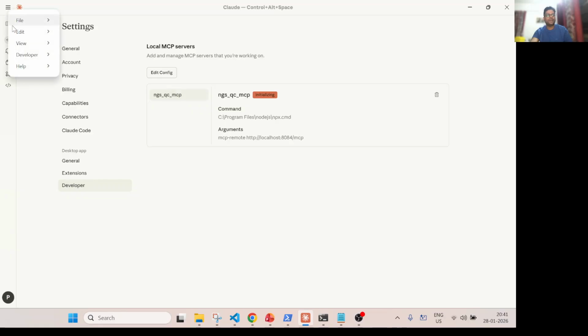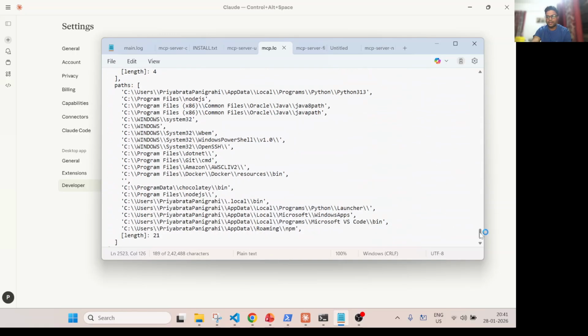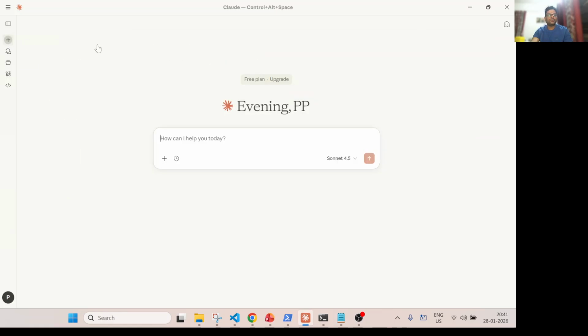Meanwhile, you can again go to developer mode and check the MCP log, and ideally it should not give some error, and it should show some message from the server. So that means it's now running. So better we can check in a new chat. Hey, what MCP local server do you have? Okay, so let's check.